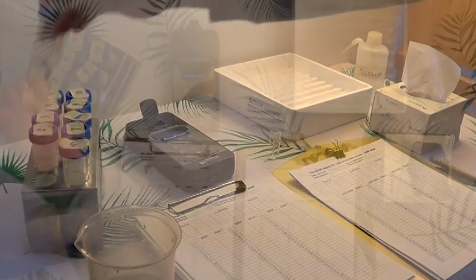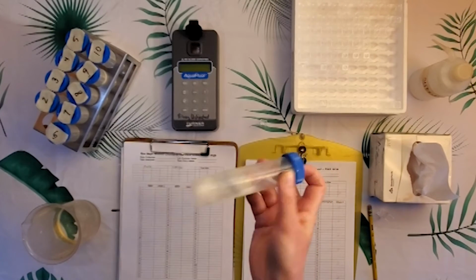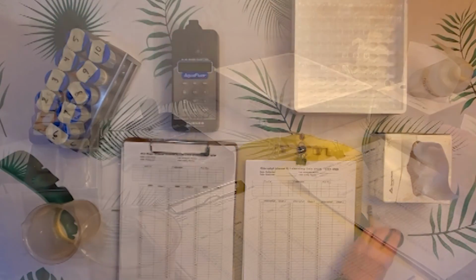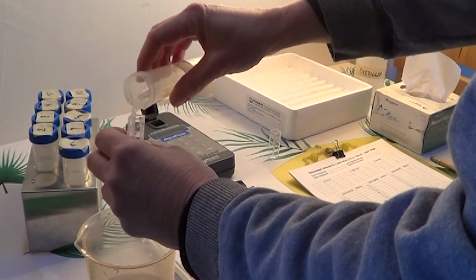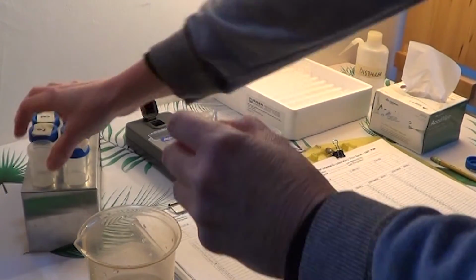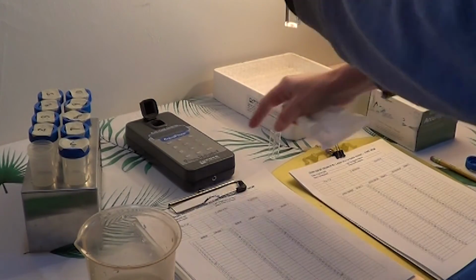And then we're going to take our first sample, give it a nice shake here. And we will pour that in close to the top of the cuvette. We'll take one of our AccuWipes, and again here we're going to give this a nice thorough cleaning to help remove our fingerprints and any water that may be around the cuvette.